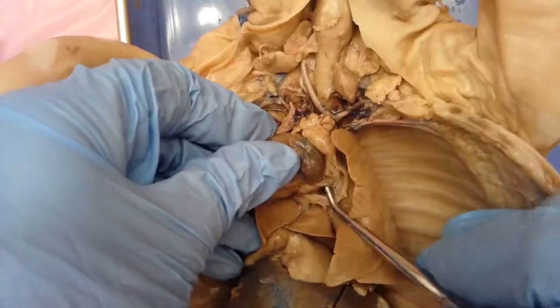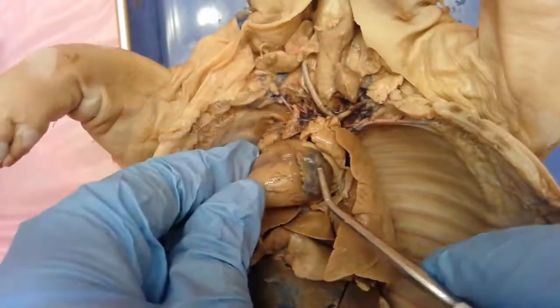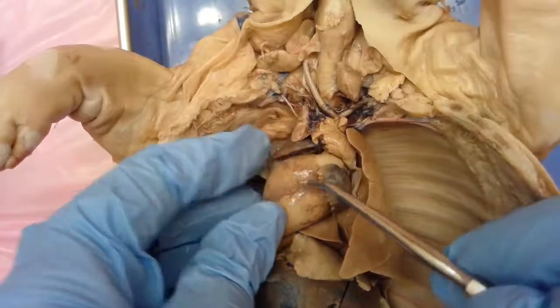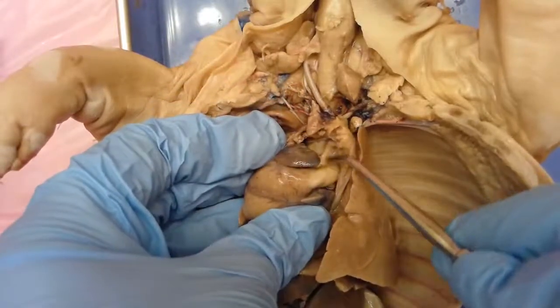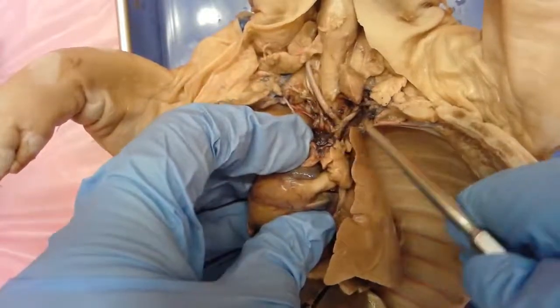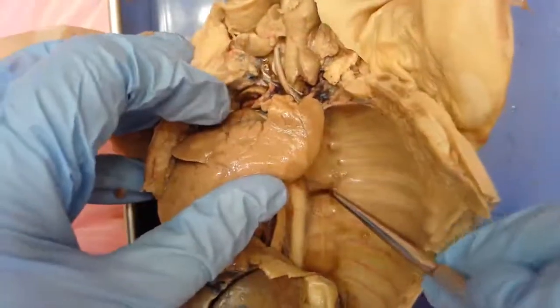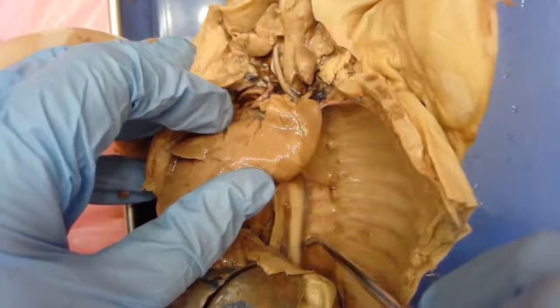You can kind of see them a little bit right there. That is a pulmonary vein that's leading back into the left atrium. And the left atrium will send it to the left ventricle. Then eventually it will get pumped out of this big blood vessel here at the top — that is the aorta. The aorta comes up, and you can see where there are branches that come off of there that go to the upper part of the body. But then there's also a part that comes all the way down and curves back behind here, and we can actually see that behind the lungs. You can see it branching all the way down — that's the descending aorta.